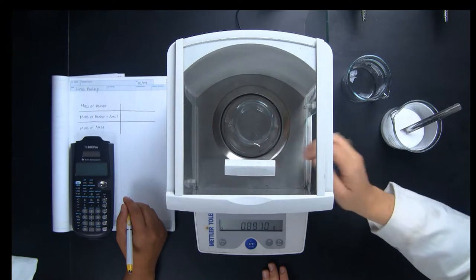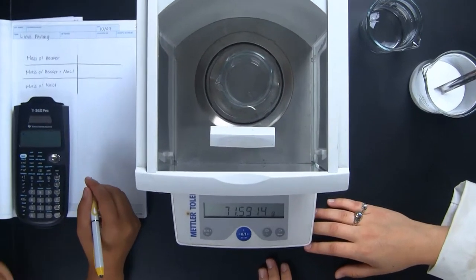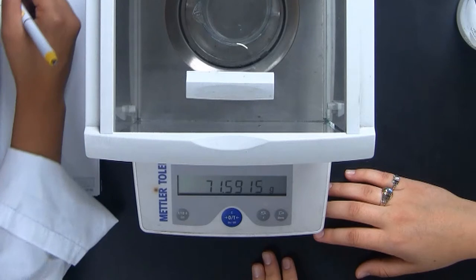Ileana will measure the reagent into the beaker. Ileana places the beaker onto the balance pan to record its mass.